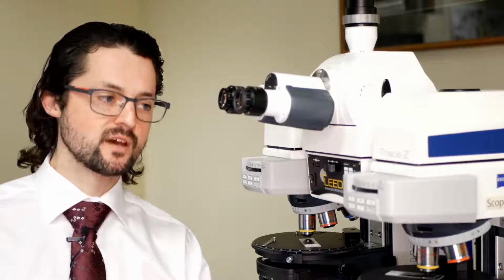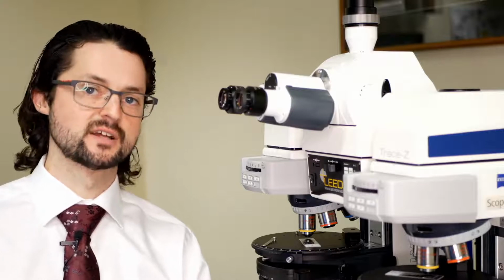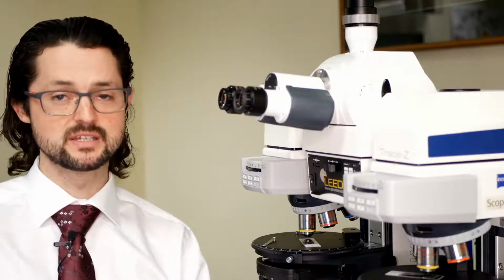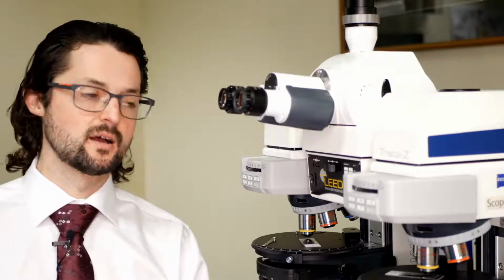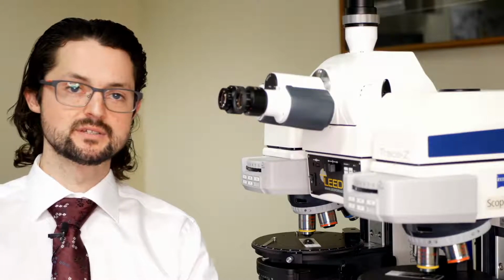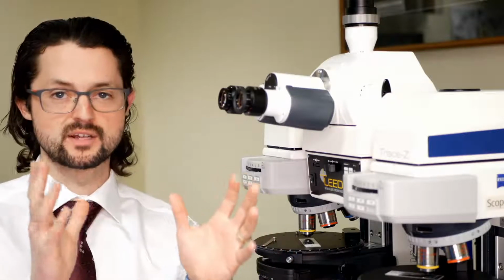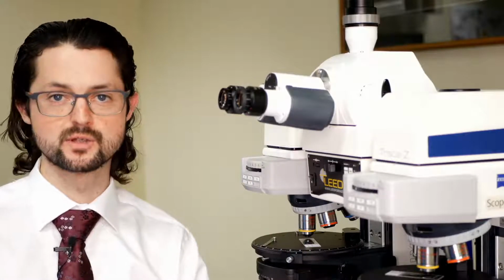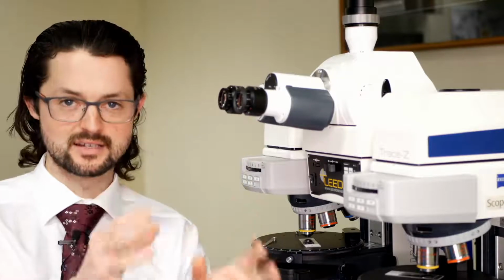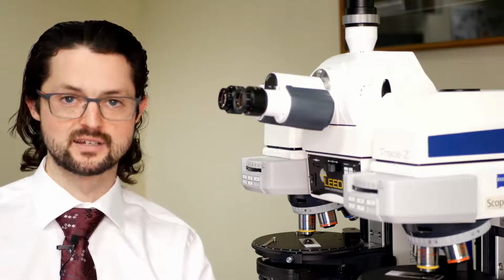And so what we've done in the past is, when customers of ours have expressed interest in reflected light Brightfield and reflected light pole, at the same time as being interested in fluorescence, which is also technically a reflected light technique, what we would need to do is sell you two separate light sources. One light source would be for your reflected light fluorescence, which is usually a mercury light source, or a mercury burner, or a metal halide, but ultimately it's a specialized light source for fluorescence excitation. And then we'd also sell you a halogen light source.